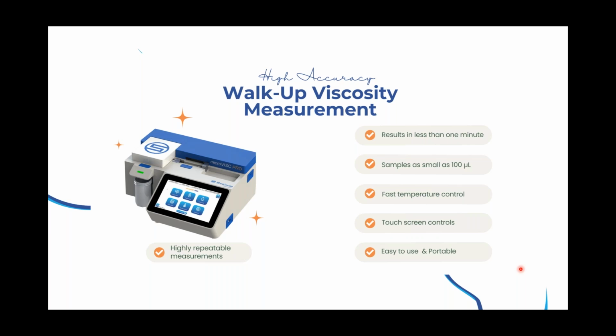So as my colleague mentioned, it has a touchscreen display with a built-in software. So you don't have to connect any computer to it. So it's a very nice display. It kind of reminds me of an iPhone screen. It makes it very fast to manually measure sample after sample. So actually just yesterday, my colleague measured about 100 samples with this unit alone.